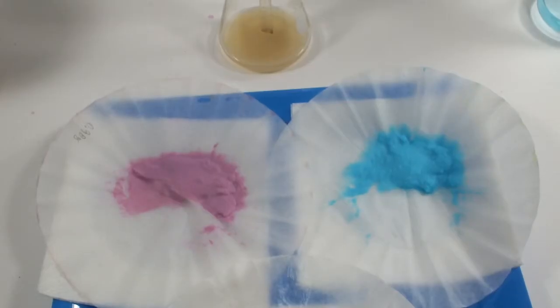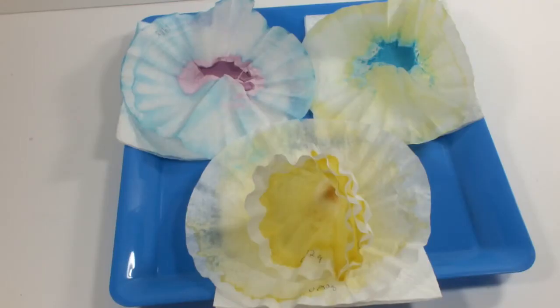The iron was particularly painful to filter. You can probably tell there was some cross-pollination while the filter papers were drying, and I'm pretty sure that extra shot didn't take all the metal ions out of solution.